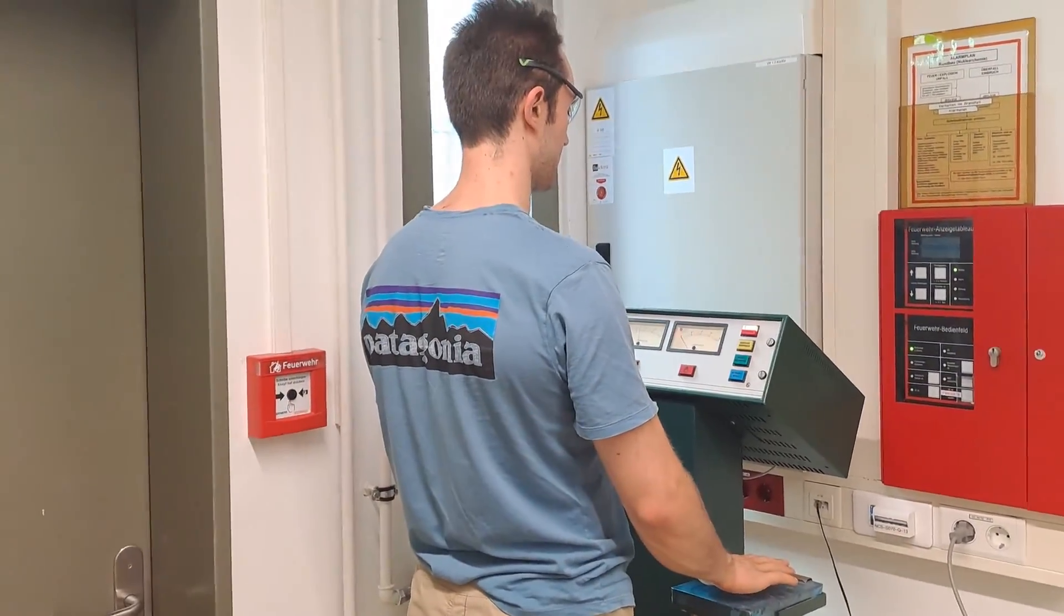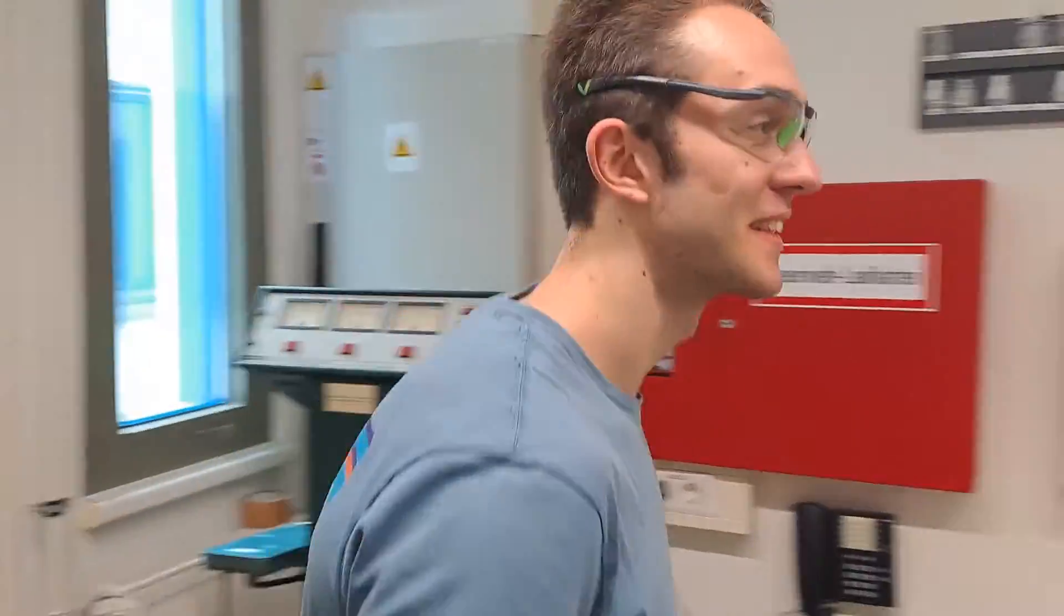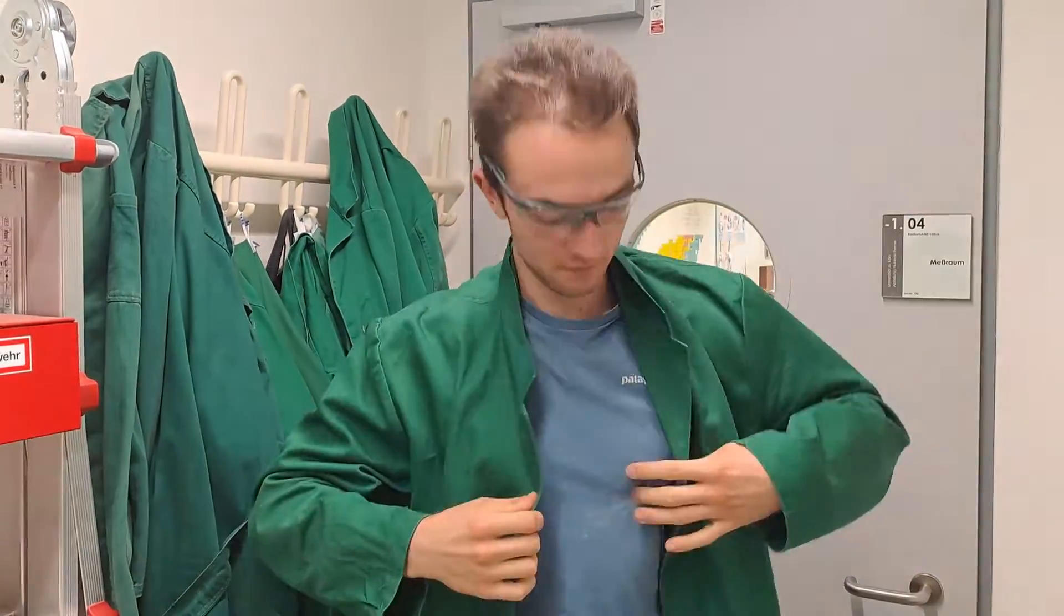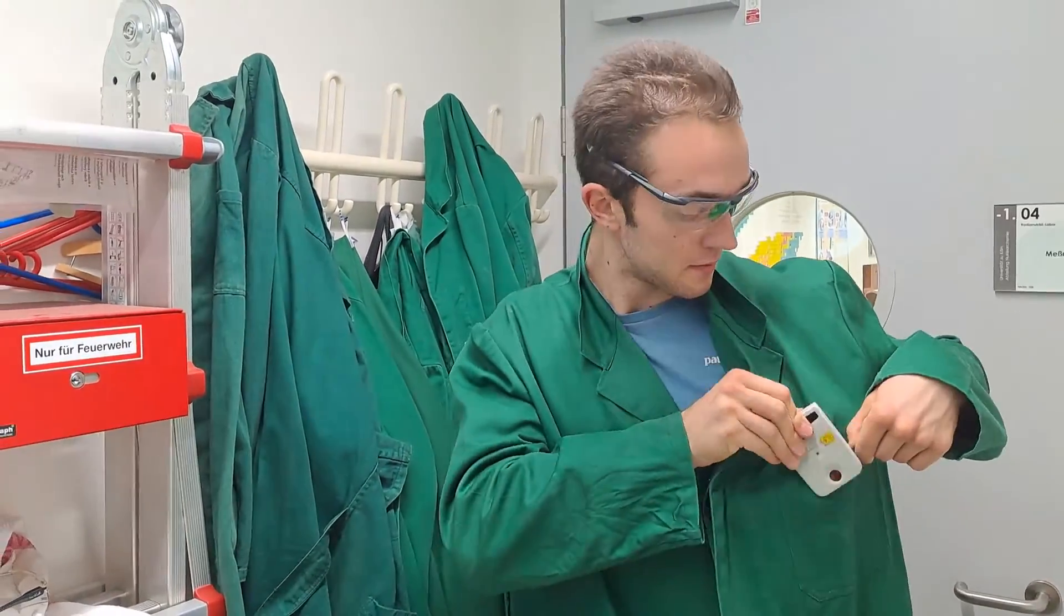Of course, like in all laboratory works, the essential scene for checking for radiation levels, putting on the green lab coat and wearing the dosimeter is necessary.